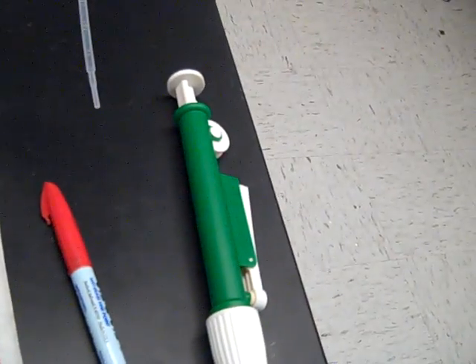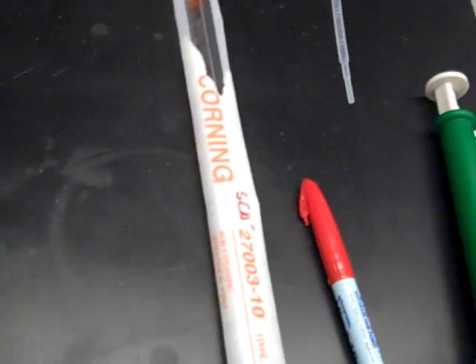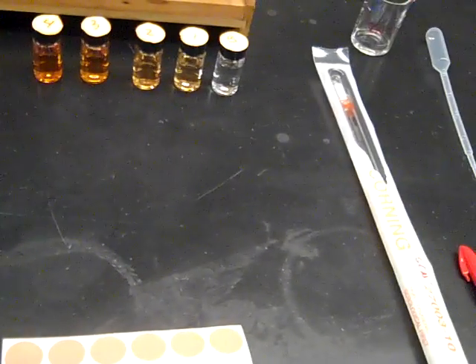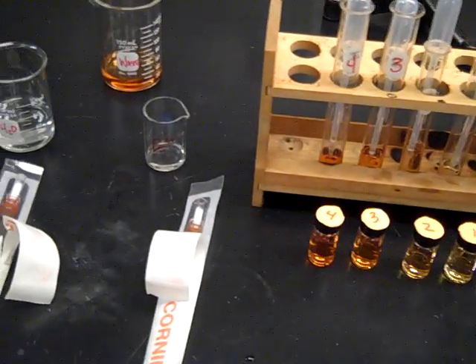You may have also noticed the dispenser used on those other graduated pipettes when you are filling up your test tubes from the samples of iron nitrate and the thiocyanate. So there is your setup.